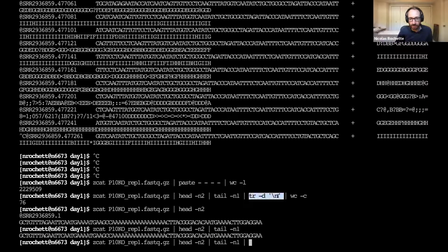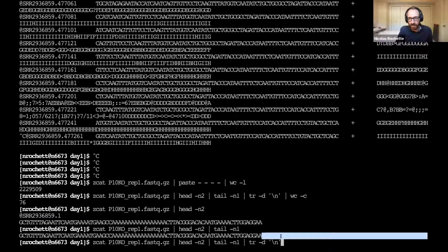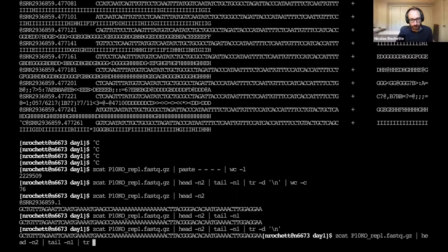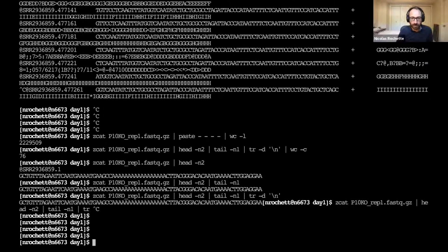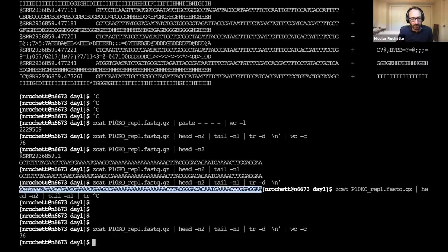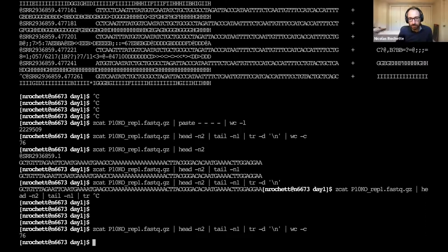And then we can add the tr deletion of the newline character at the end. I'm talking about this newline character here, the one that's selected now, that goes from this A and then back to the beginning of the line. That's a newline character. Now if I remove that character, the one thing that was between the A and the newline is not there anymore. And then I can count the number of bytes in that sequence. That's for the first read.